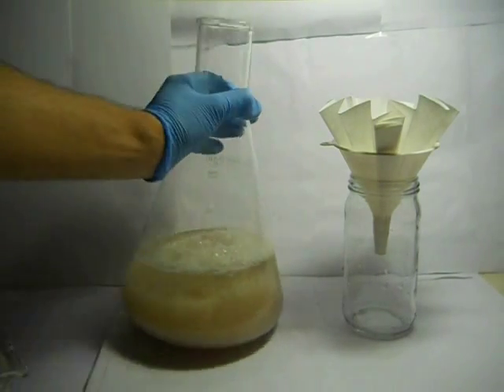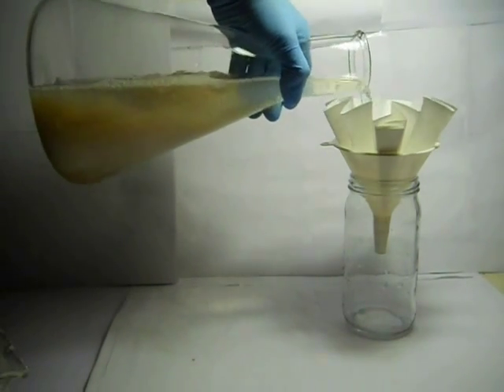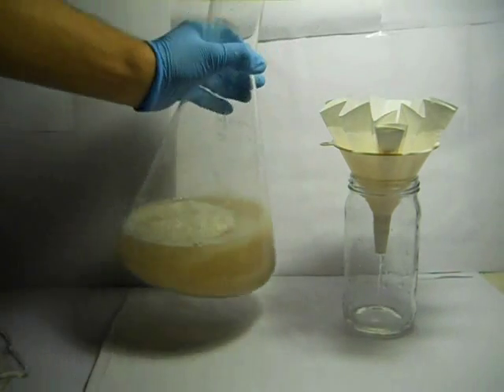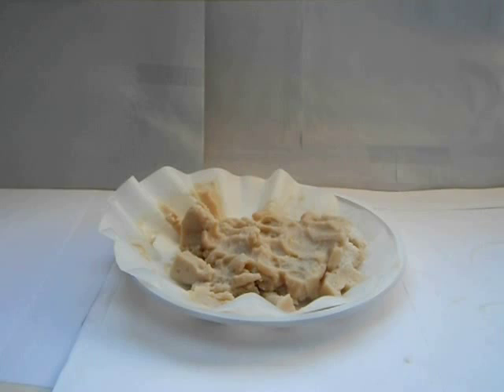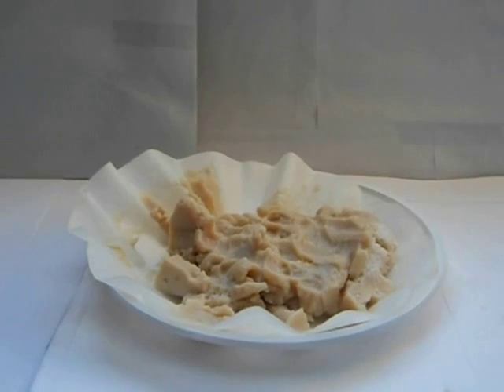Now you have to filtrate your product, and I tell you that this filtration will also be very slow. Obviously, you have to let it dry for about 1, 2, 3 days.